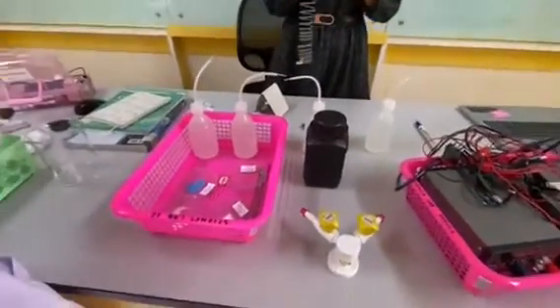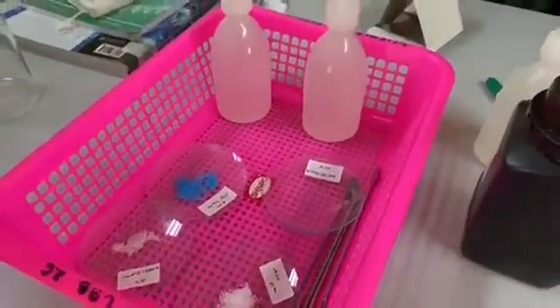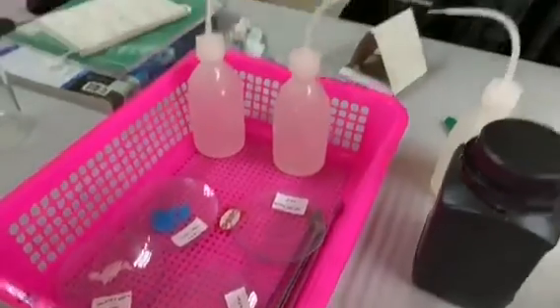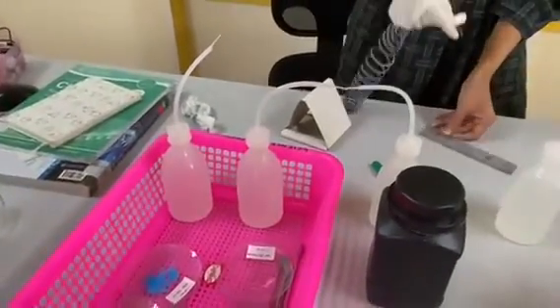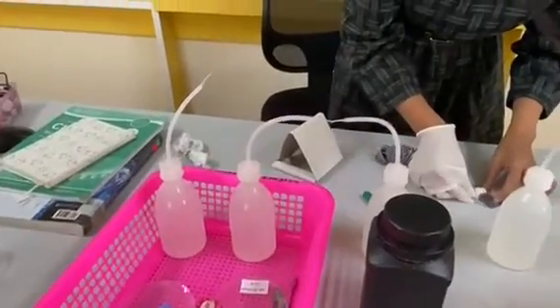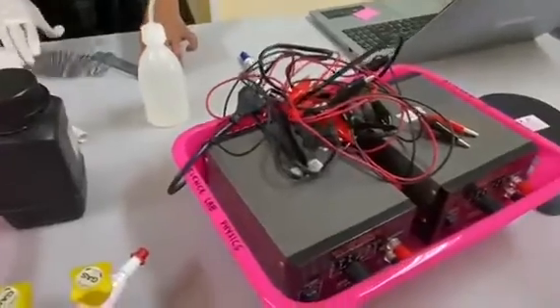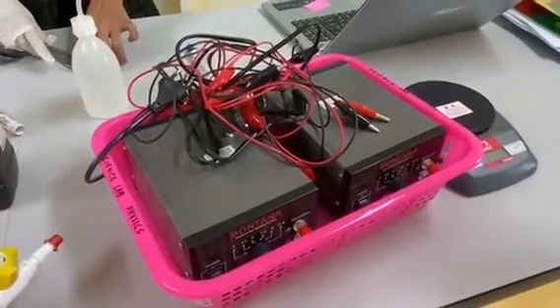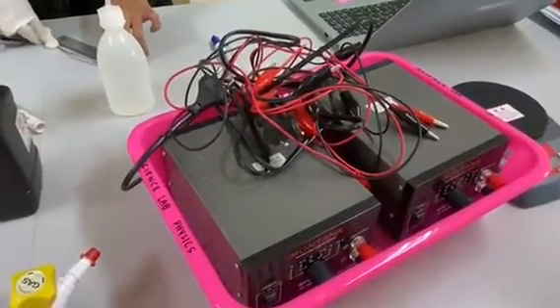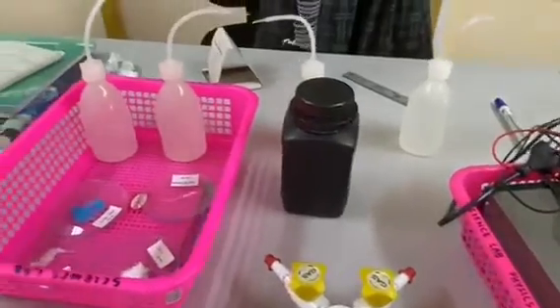Now, we are split into 4 different experiments, and I am experimenting with copper sulfate or CuSO4 with C electrodes at 9 volts. The apparatus I'm using is one beaker, a 9 volt power source, 2 pencils as the electrodes, 200 milliliters of water, and 0.5 grams of CuSO4.